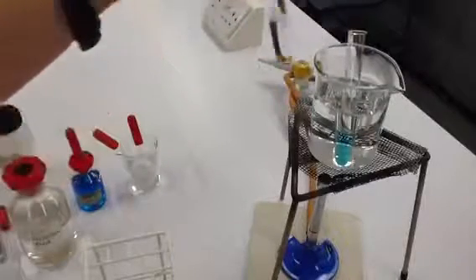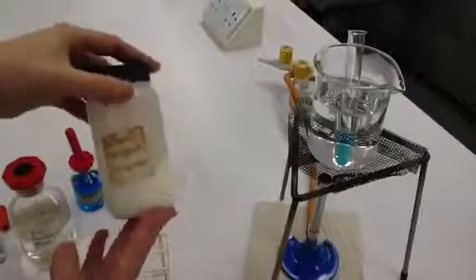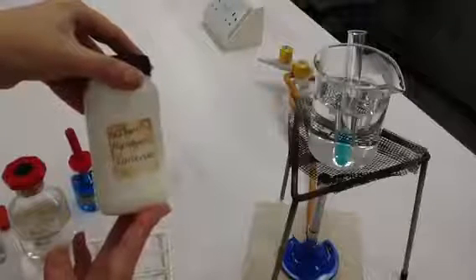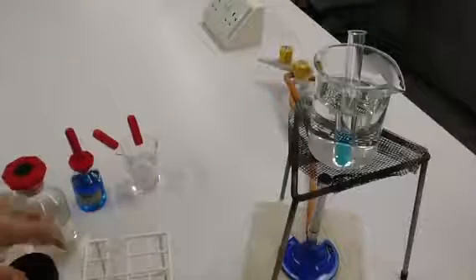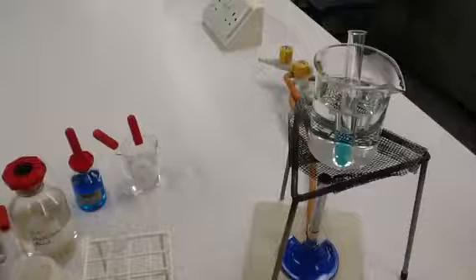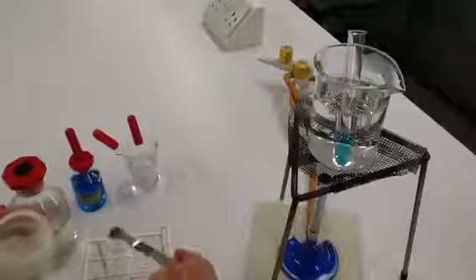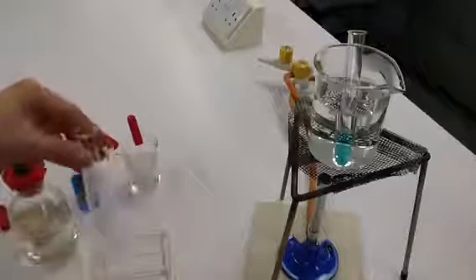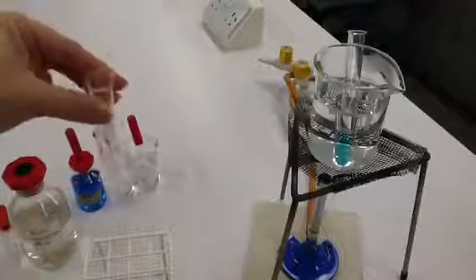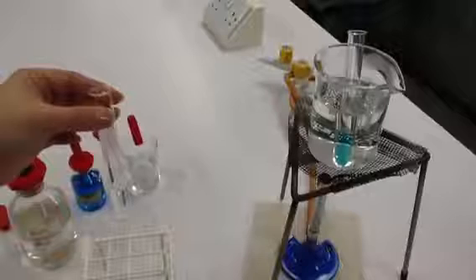So two or three minutes has passed. What we need to do now is remove our sample and we need to neutralize that acid. We neutralize the acid with an alkaline and we tend to use sodium hydrogen carbonate. But for your exam, it really doesn't matter if you can't remember that name. What's important is that you remember it's an alkaline and its purpose is to neutralize the hydrochloric acid. We just add half a spatula full in there. As you can see, as we add the alkaline, it starts to fizz up a bit. The idea is that you add the alkaline until the solution doesn't fizz anymore and you know that has been neutralized.